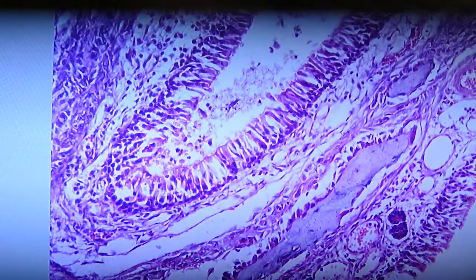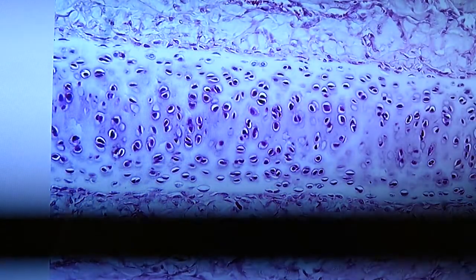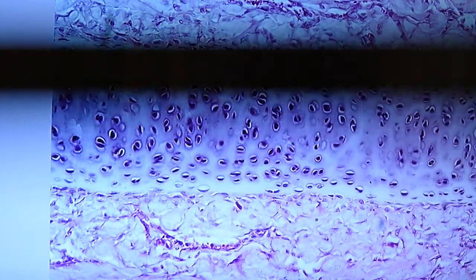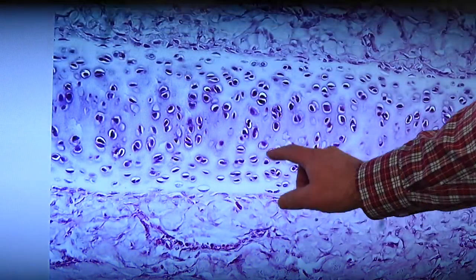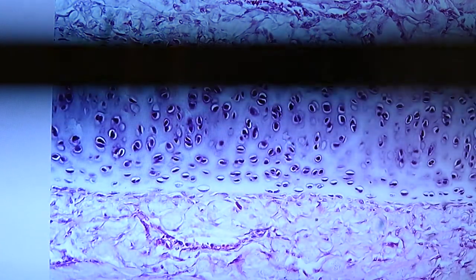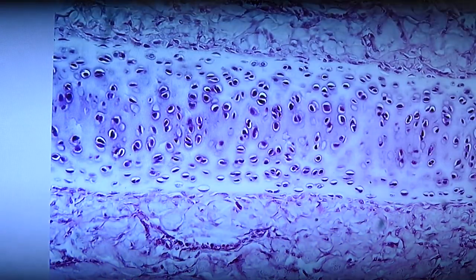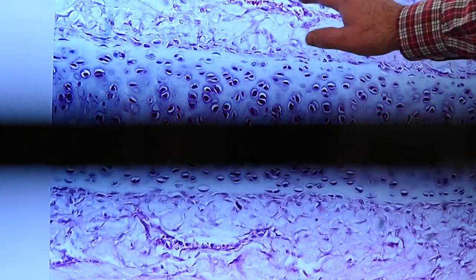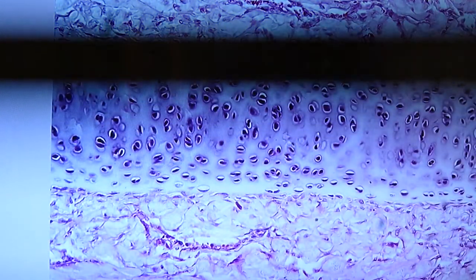In our next picture, we're going to see some hyaline cartilage. There's a good span of hyaline cartilage that you're familiar with, right across the middle. The dense connective tissues that lie right adjacent to that, right on the top, those are going to be perichondrial tissues. It's dense connective tissue of the cartilage, the perichondrium. And then beyond that, we have loose connective tissues.